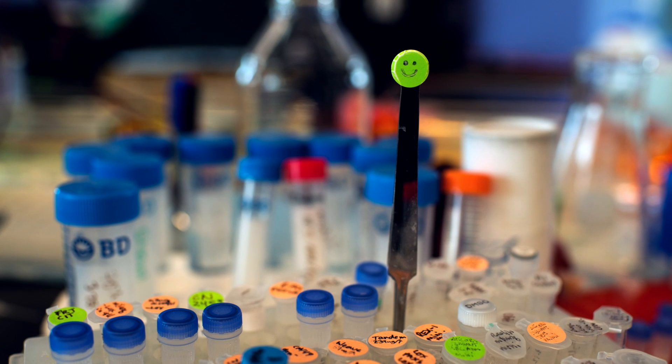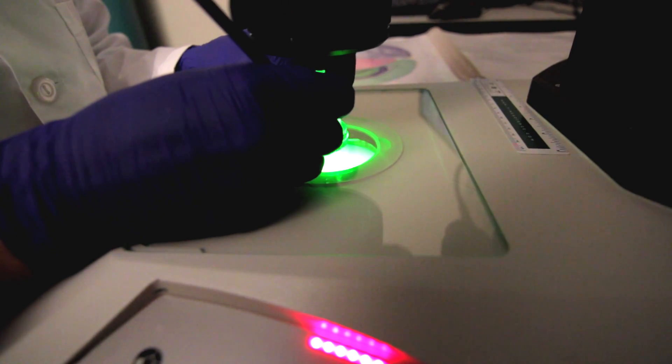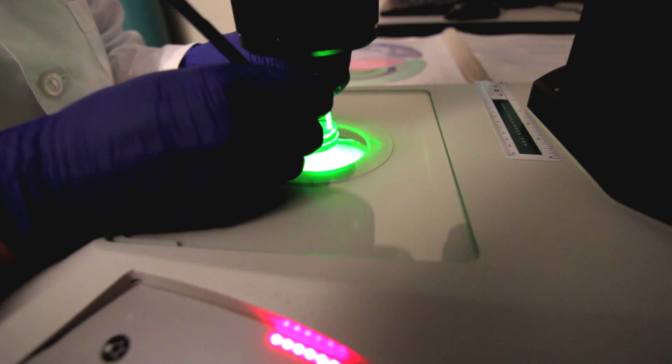The reason we're working at the single cell level is because the brain is inherently a complex tissue with many different cell types. If we want to understand what's unique about each different cell type, we want to be able to measure them one at a time. Different cells in each different tissue have unique jobs, and it's been hard to really understand what's happening in very unique and rare cell types. So I was very interested to start understanding how to measure single cells.